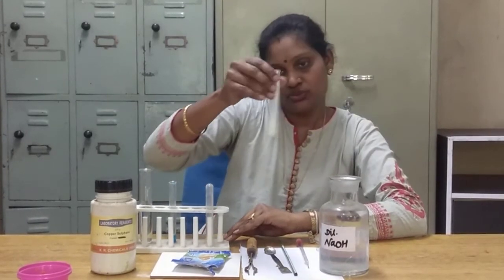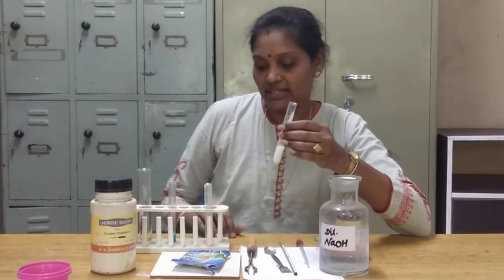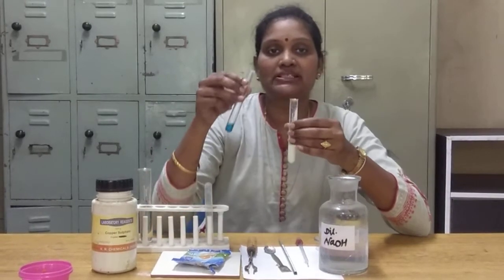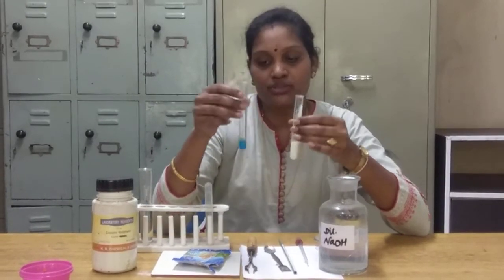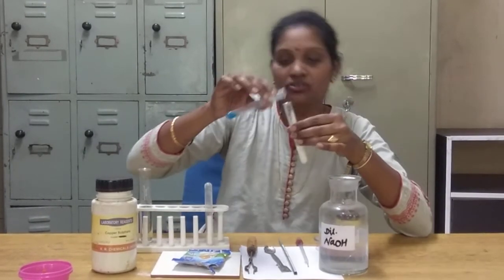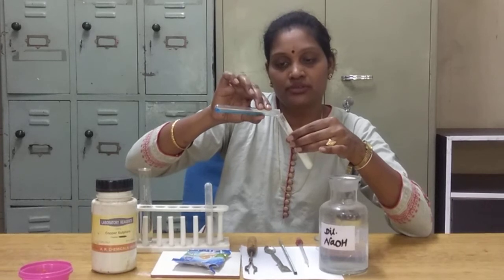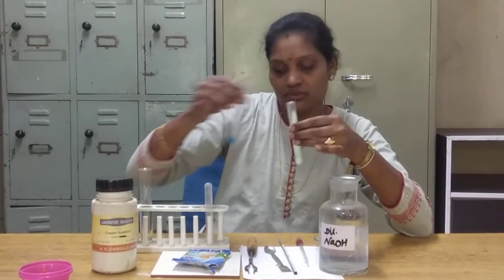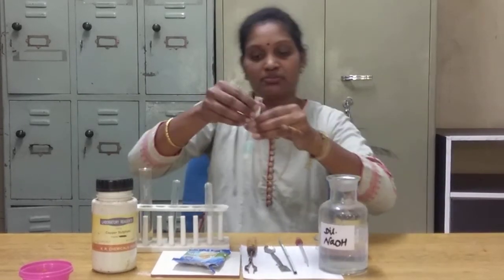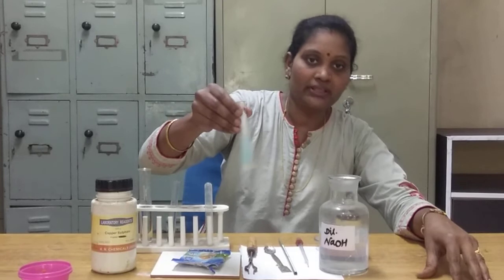Now you can see the solution. I will add two drops of copper sulphate solution — this is the blue colour solution called copper sulphate solution. Now copper sulphate is mixed in the test tube.